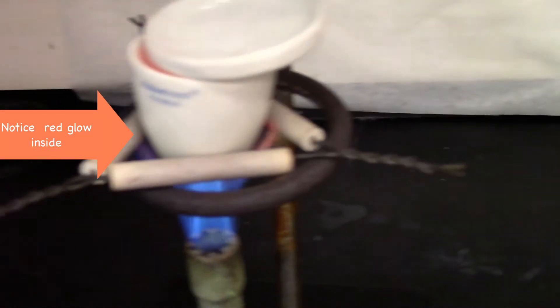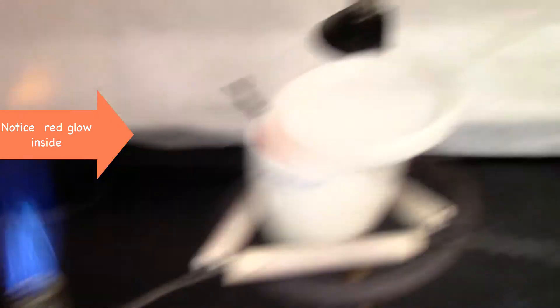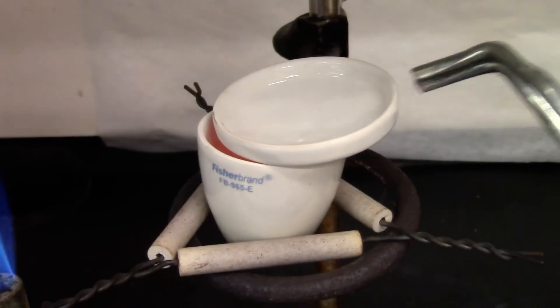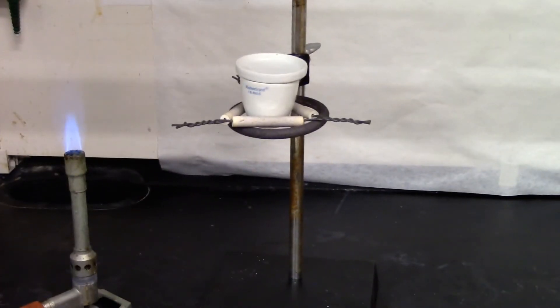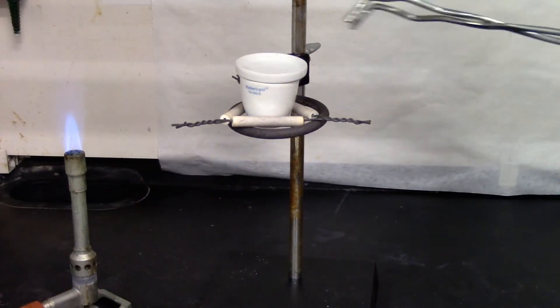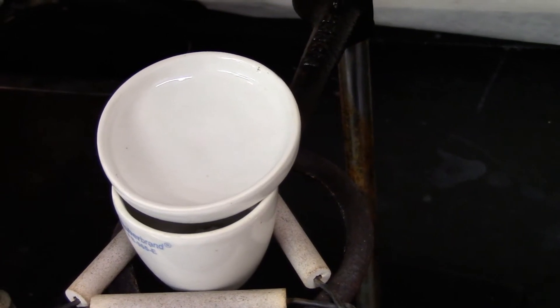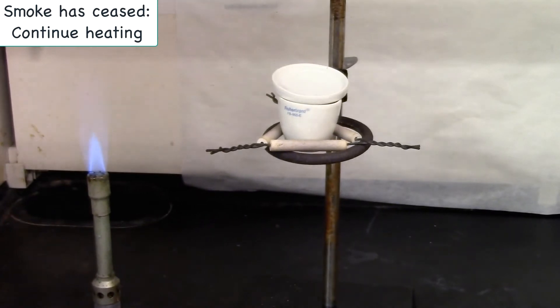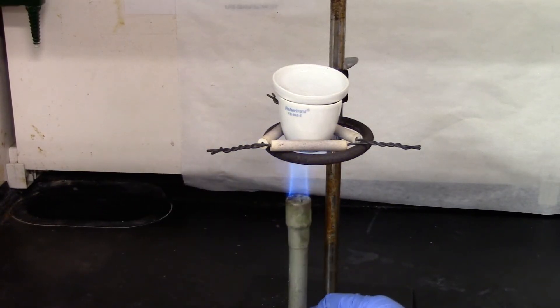So it has sparked. I'm going to remove the flame and cover the lid. Again I'm going to open the lid. I'm going to keep the lid partially open just like this and then heat it for another 5 minutes.